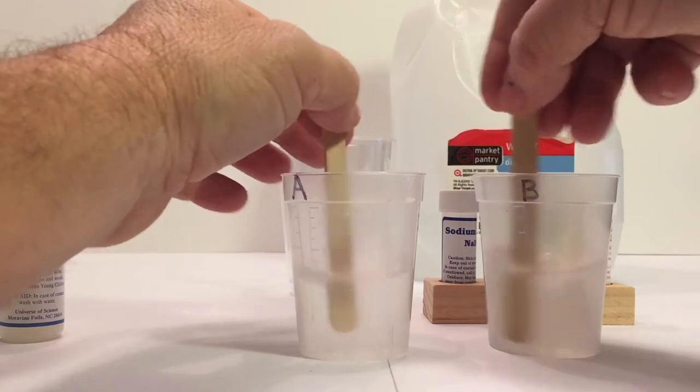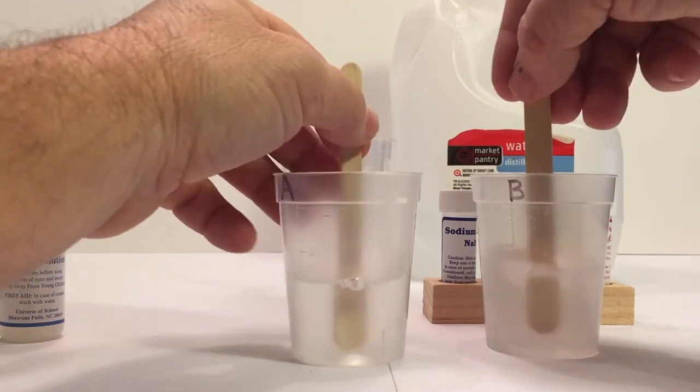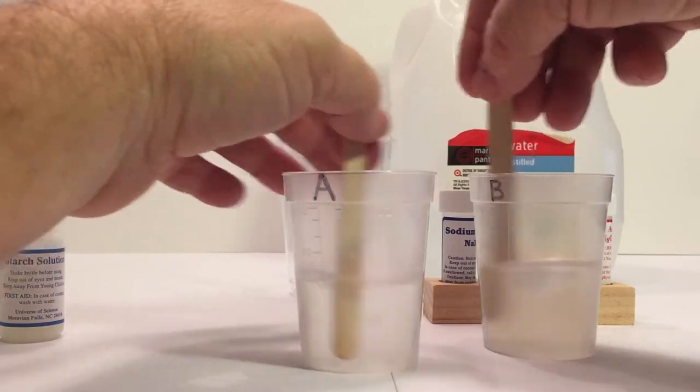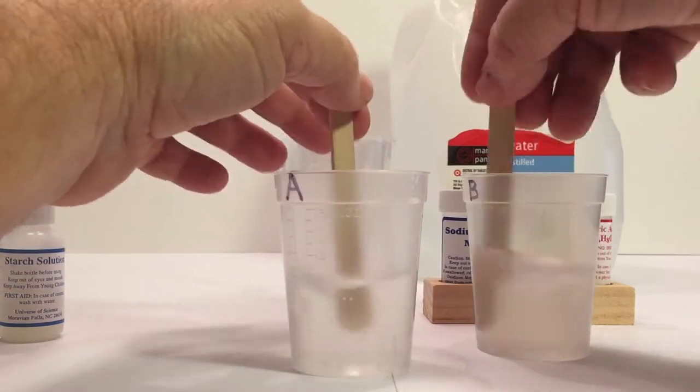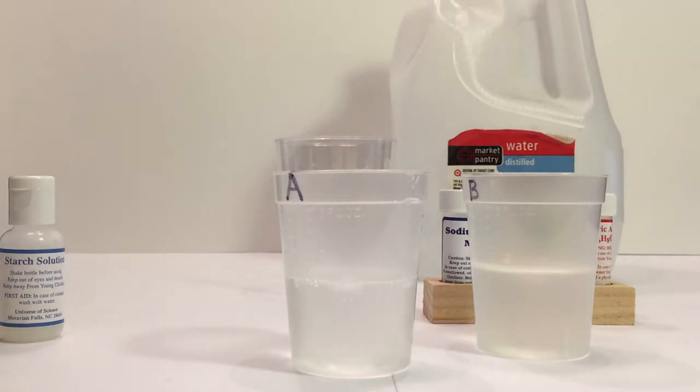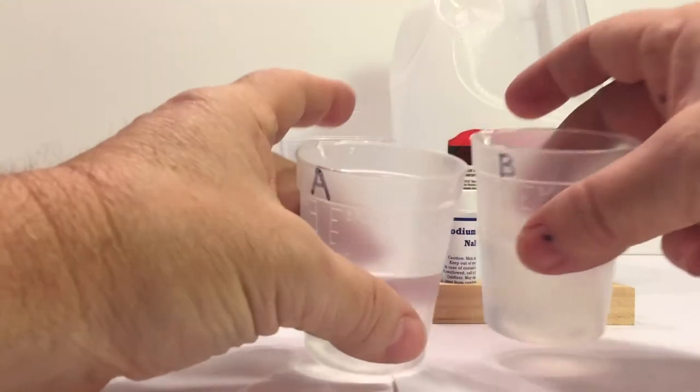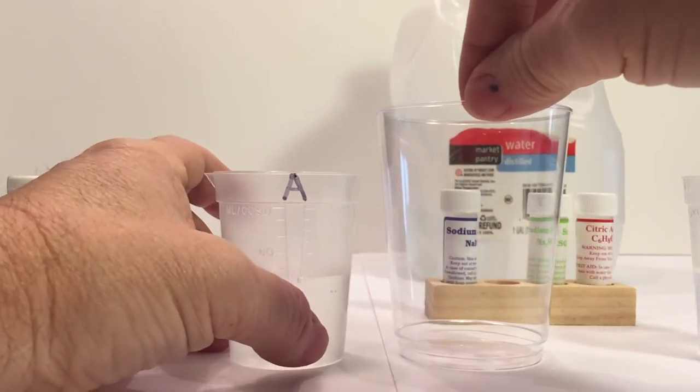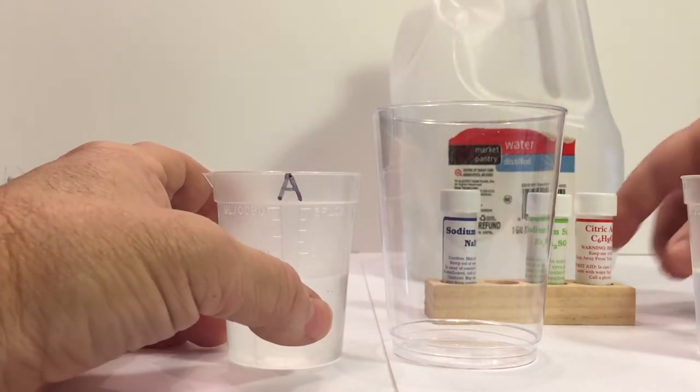And what you're going to have to do is supply yourself a plastic clear cup that I will bring in. We're going to pour both A and B into one single cup. And they do not supply this cup in the kit, so you're going to need to get it yourself. And so I got one right here. And once we put the cup out, we're going to pour A and B into the single cup in the middle at the same time.